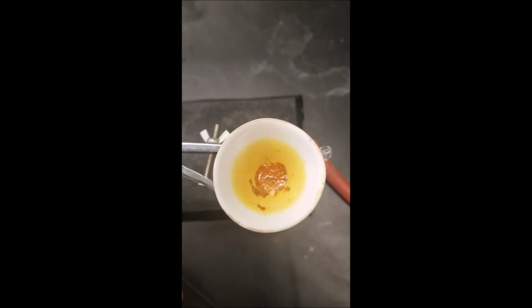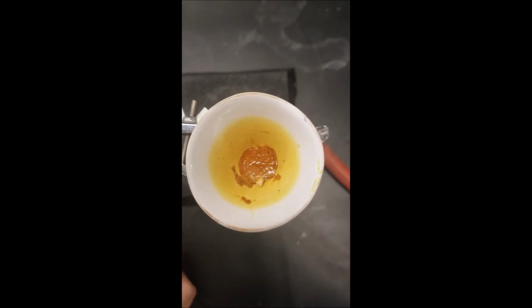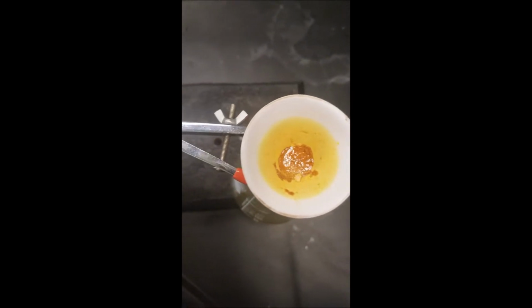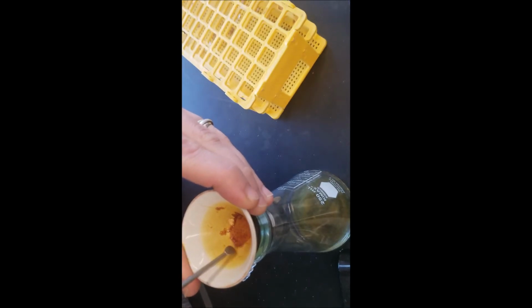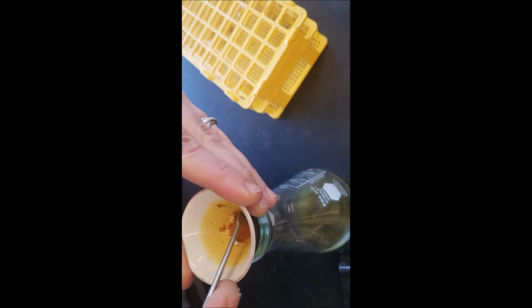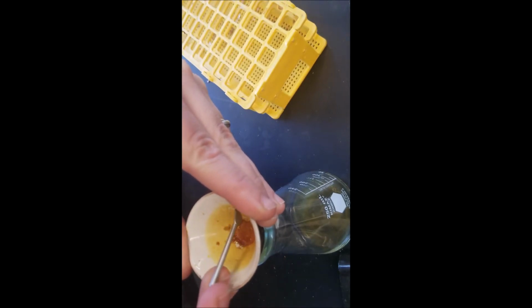This is my solid, or what's remaining of it after I've let it drain overnight. So we'll see how much I can extract. I'm going to let this dry for a little bit longer. Here goes nothing. So after nearly 2 days of letting this dry, I'm going to try to extract the solid. Oh, jeez. Oh my god. Okay, that's not. Extract this solid. It's very sticky.